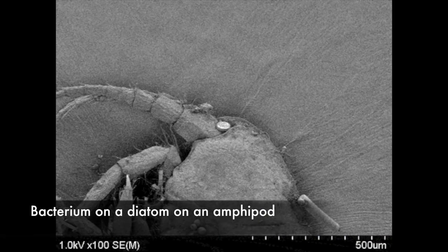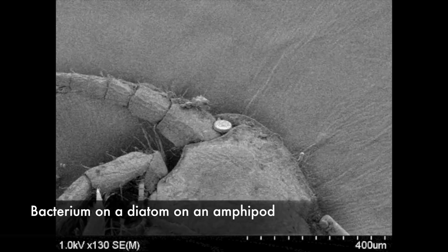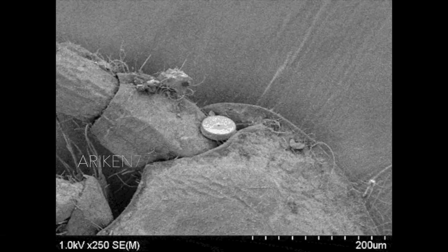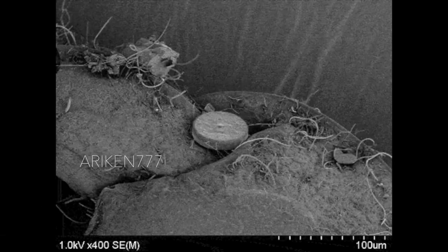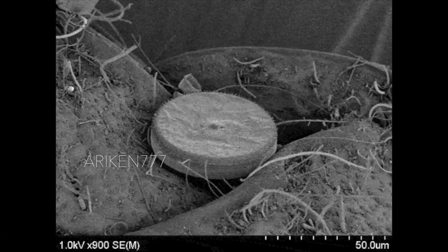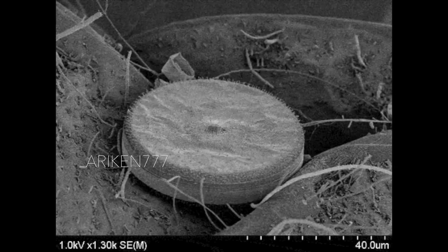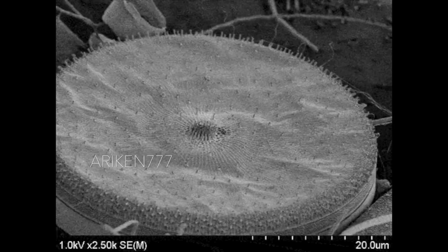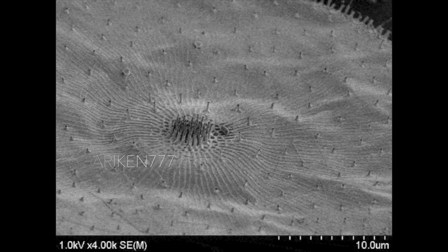The final stop of this zoom, which spans multiple orders of magnitude, is a little bacterium. That bacterium is resting on a diatom. The diatom is in turn sitting on an amphipod, a type of small crustacean.